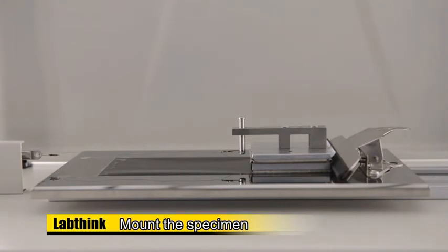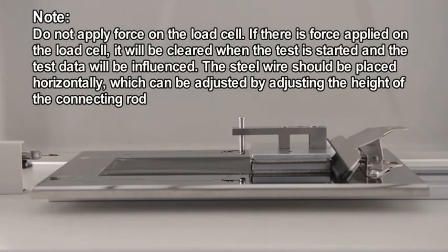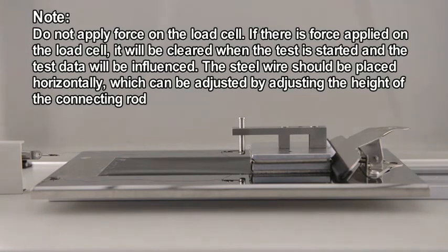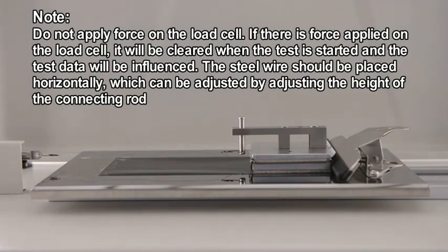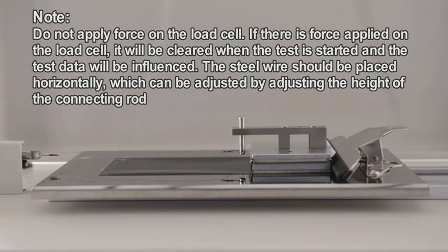Connect the load cell and sled with the steel wire, which should be stretched almost straight but slightly loose.